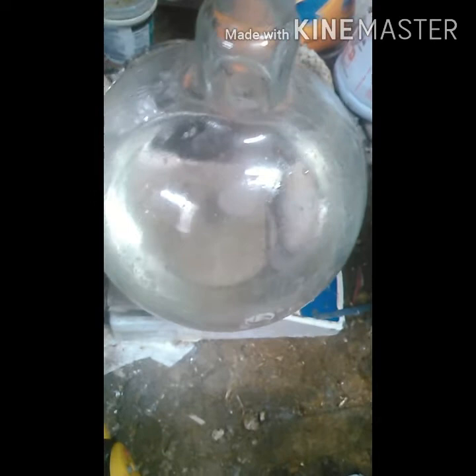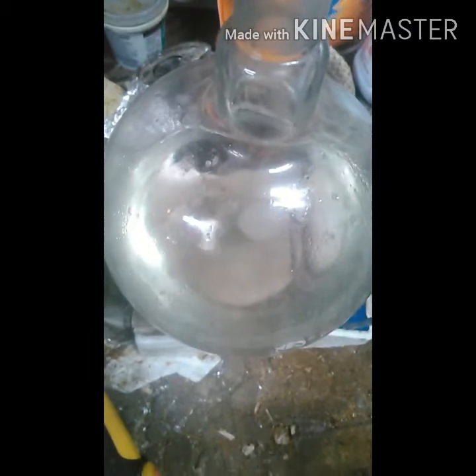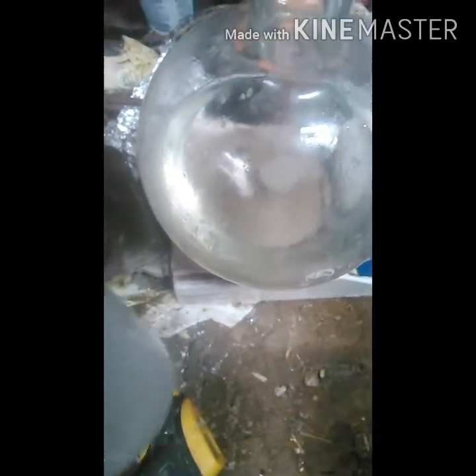I put all the solution that came in the tube of Passion into this boiling flask. Then I rinsed it with a little bit of distilled water and put that in there. Then I made a solution of saturated sodium hydroxide in distilled water, and I've got that stirring so that the lube and the water become a homogeneous mixture. Now I'm going to add some sodium hydroxide into the solution, which is going to crash out the lidocaine.